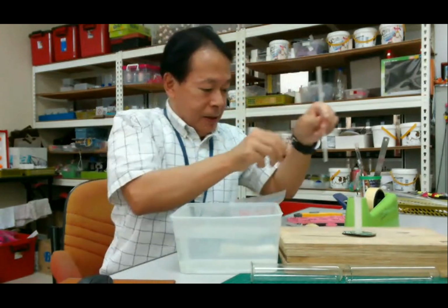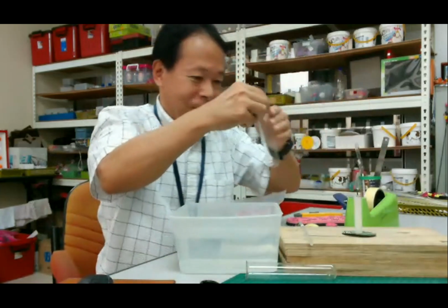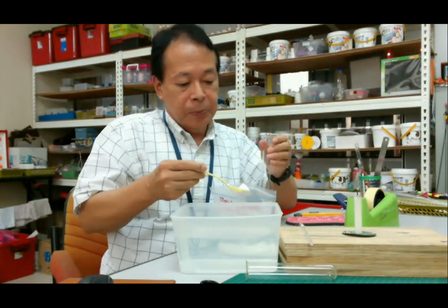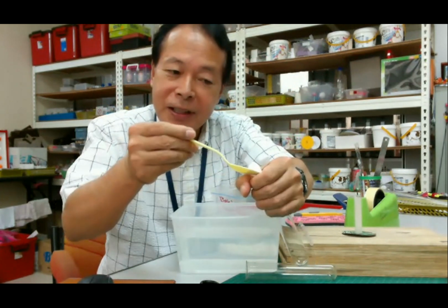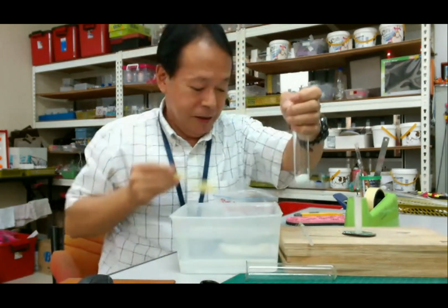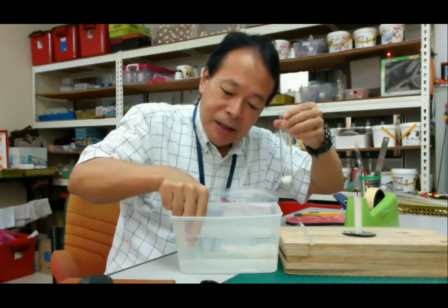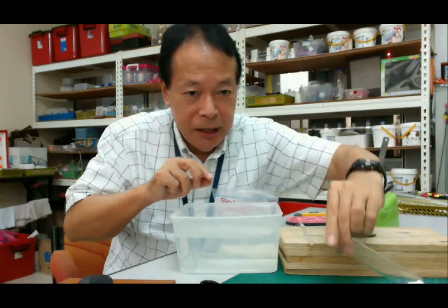Then first, before making the tube, please put the baking soda into the test tube. Half of a spoon is enough. Inside. A little more. Okay. Then we have one more test tube. This one has water, so this one we put into the water, keeping it in the water. Then I put it in the test tube here.